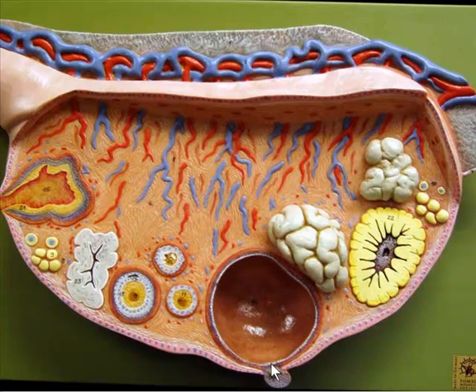So after the egg is released, these surrounding follicular cells actually turn into this structure over here, which is called the corpus hemorrhagicum, because it has some hemorrhaging on the inside. We see some blood commonly on the inside. This corpus hemorrhagicum turns into a corpus luteum, or yellow body, like you see here. So these again are the follicular cells that have now turned into a solid ball of cells that have their own function in terms of maintaining progesterone levels and maintaining the uterine lining. So this is the corpus luteum, and ultimately this will turn into a white body, which is also called the corpus albicans.